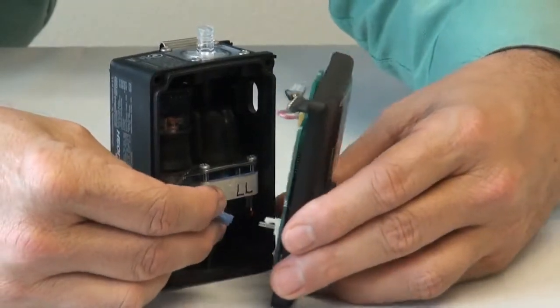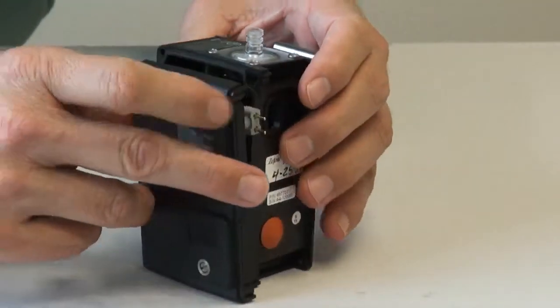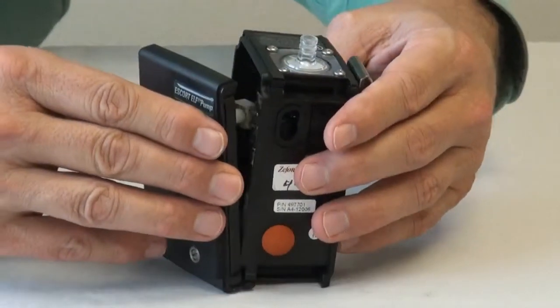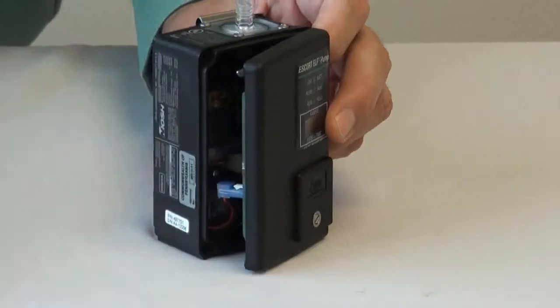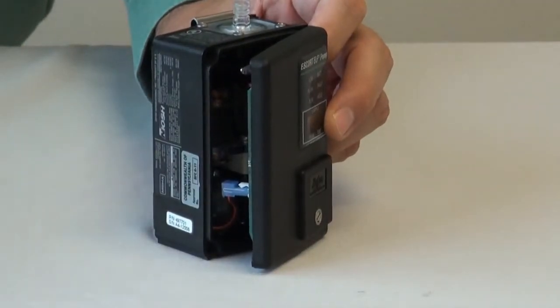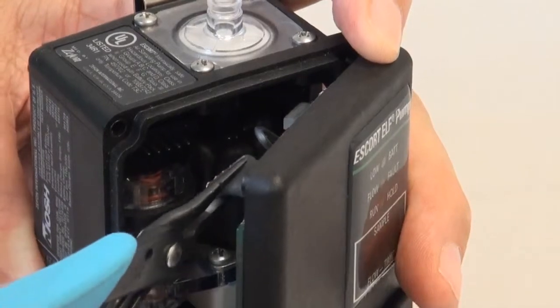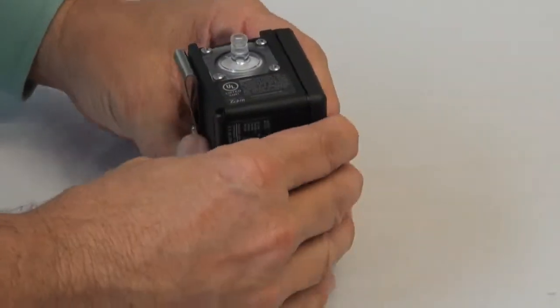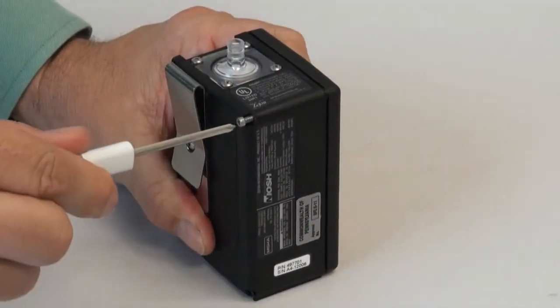To reassemble the faceplate, first connect the motor connection. Then align the battery connection with the opening, and with the small pliers press the ribbon connection back onto the flow sensor. Be sure that all 5 pins are straight and fit into the connection. Now you can insert and tighten the 2 screws.